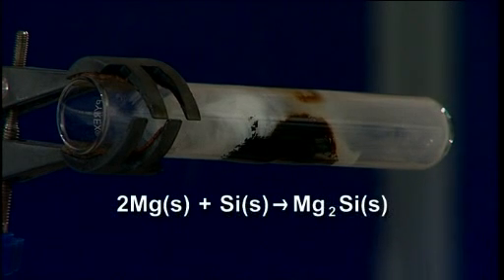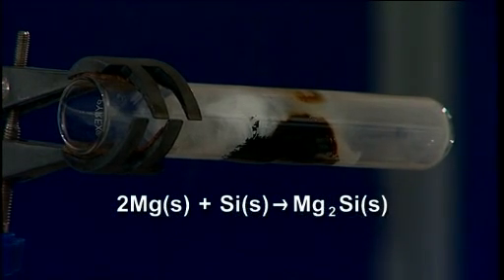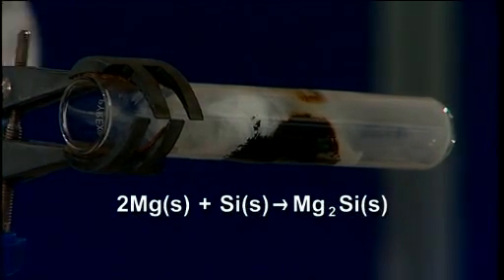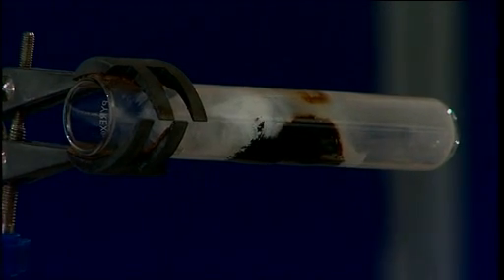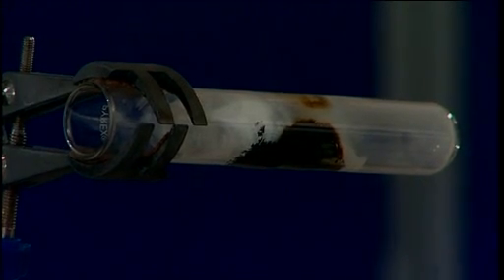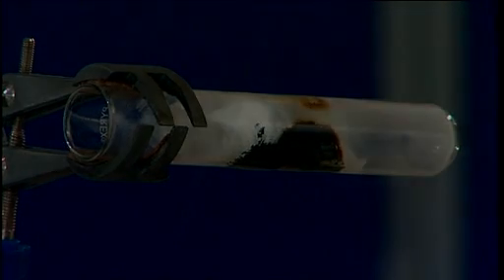It's this that's going to be interesting when we add this mixture to hydrochloric acid as part of the next step. When the reaction's finished, allow the tube to cool. This will take about five minutes.